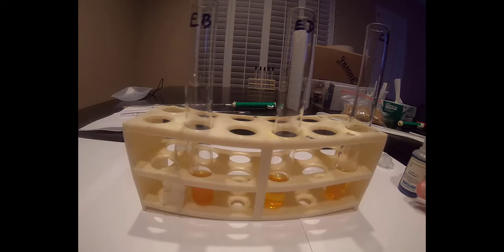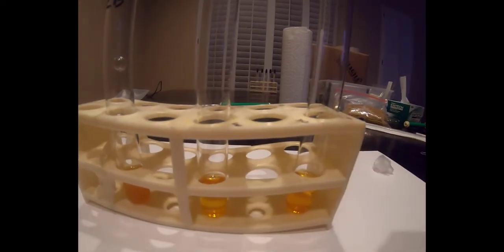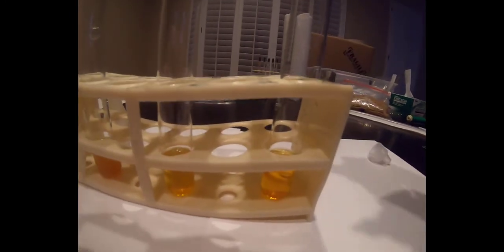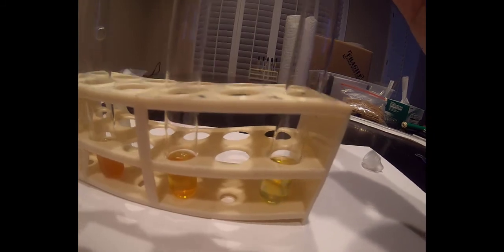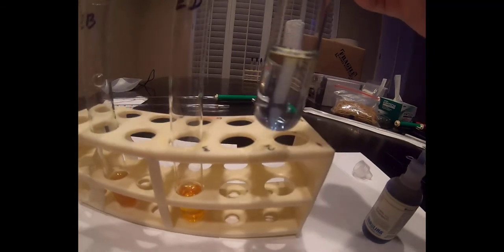Next, I will place 3 milliliters of Biuret's reagent into each tube and observe the reactions. I'll start with the control. We take the control test tube on the right, and you can see that the tube contents turn blue when I add Biuret. This is a negative indicator for protein, which is as we would expect because we know that our control only had water in it. Next, we place Biuret solution into the solution from the experimental beaker. And again, we see a blue color, indicating that no protein is present.